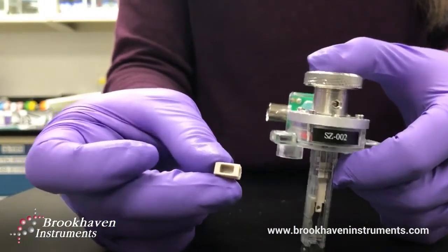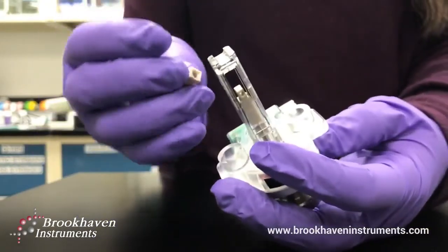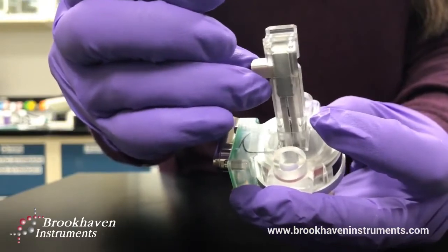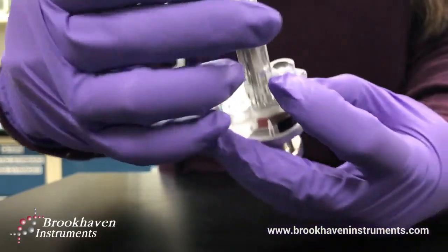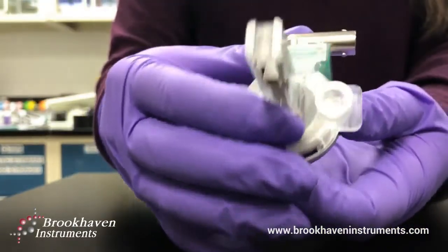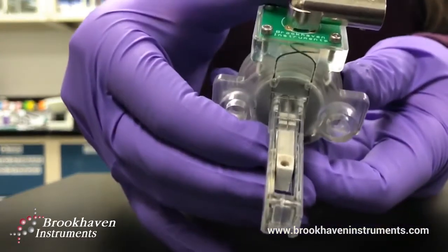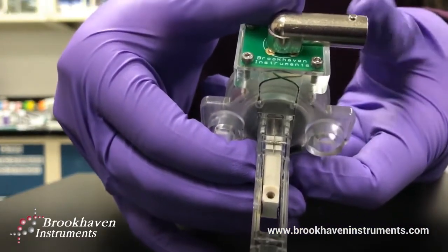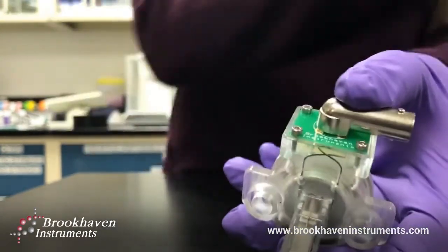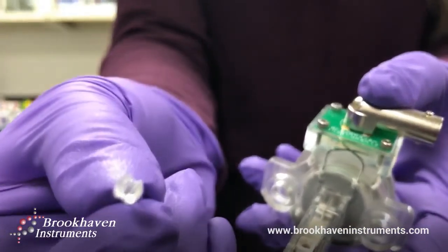We can then mount our sample onto the electrode assembly for measurement. Insert the substrate onto the movable arm. Then screw in the included screw until tight and flush against the substrate.